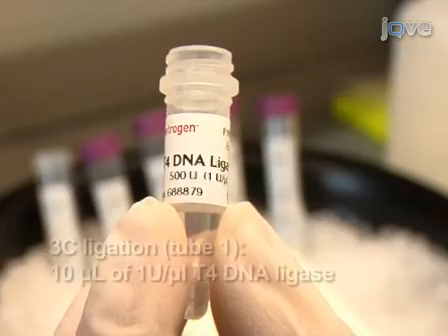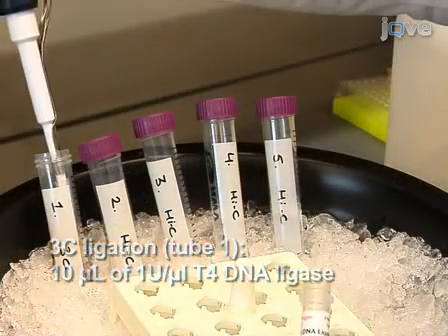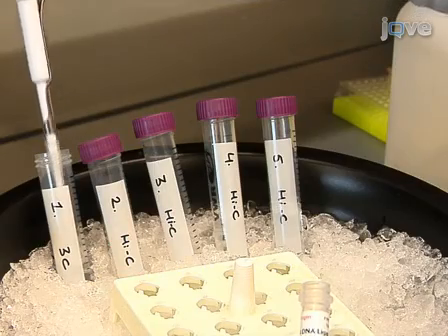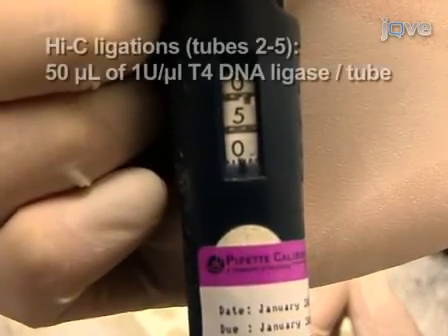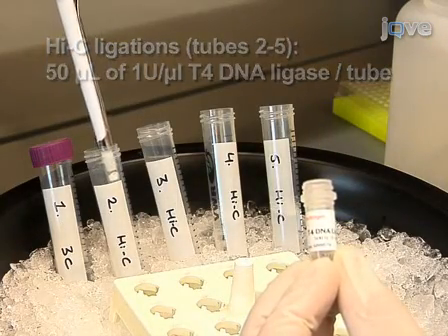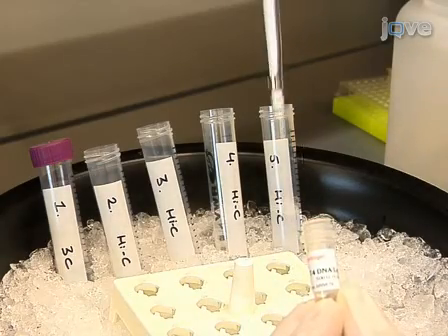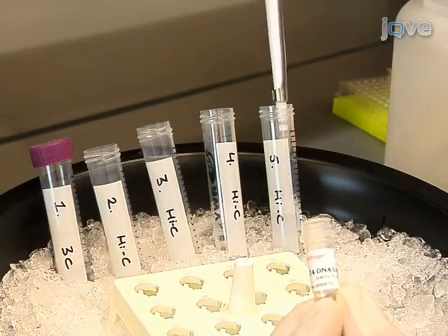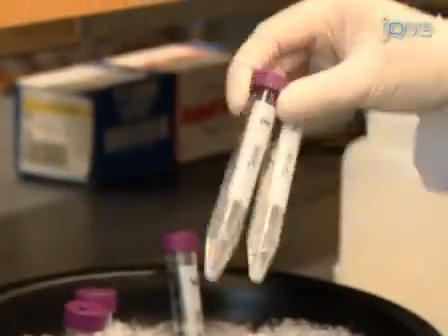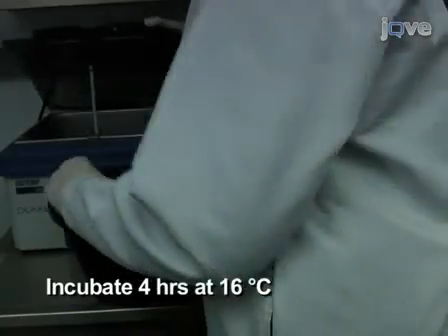Add 10 microliters of T4 DNA ligase to tube 1 to perform a regular 3C ligation. Then, add 50 microliters of T4 DNA ligase to tubes 2 to 5 to perform blunt-end Hi-C ligation. Mix the tubes by inverting them and incubate for 4 hours at 16 degrees Celsius.